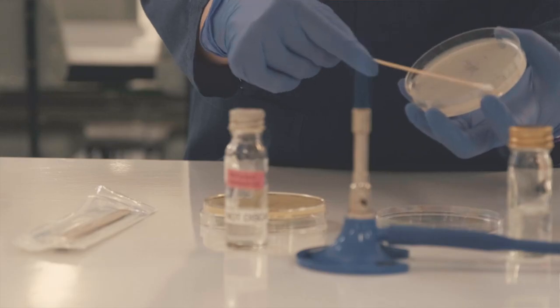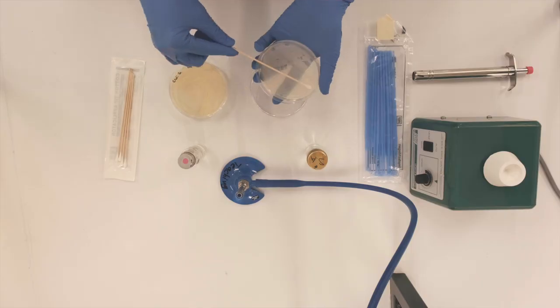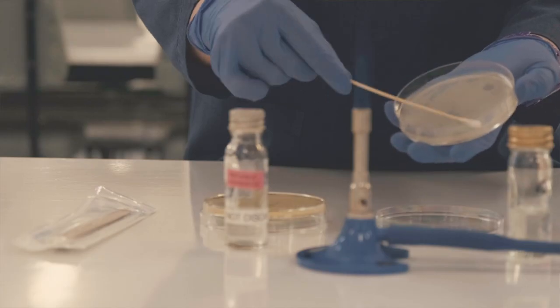To maximize coverage, we turn the plate at different angles, repeatedly spreading the bacteria across its entire surface.